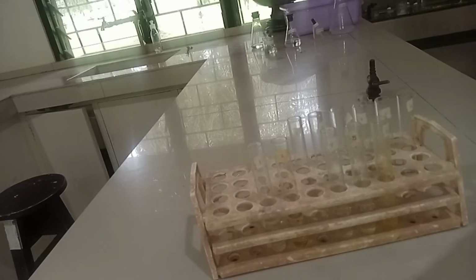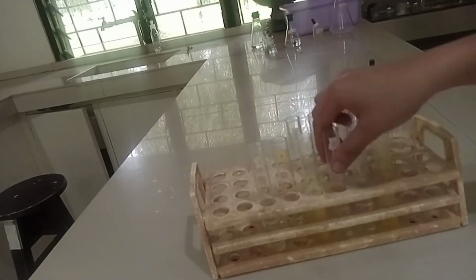Neutralize the acid by adding 3 ml of 6 molar sodium hydroxide, and mix. During the hydrolysis, a precipitate may form, especially in the egg yolk sample. The sample in which a precipitate appeared must be filtered.